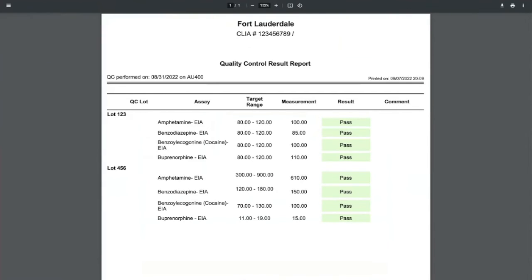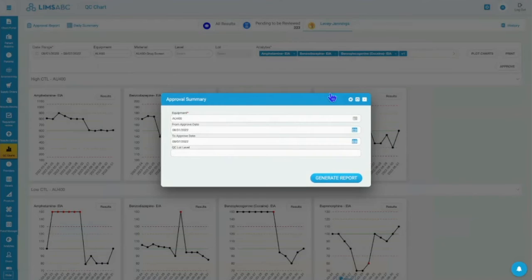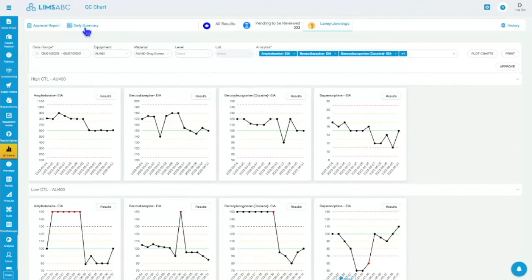But so we have these two reports. Let me close this one. These two reports, the approval report and the daily summary report, we can customize. And then we have the history that I mentioned, which is your approval history of your monthly results.